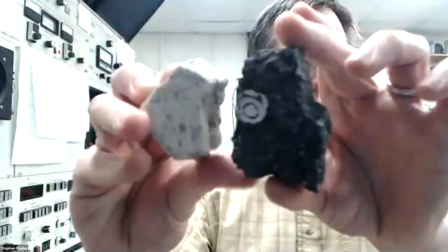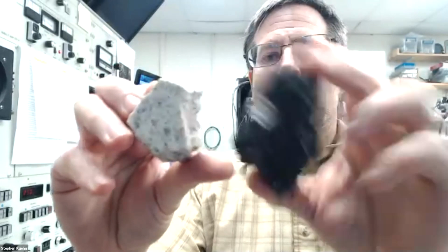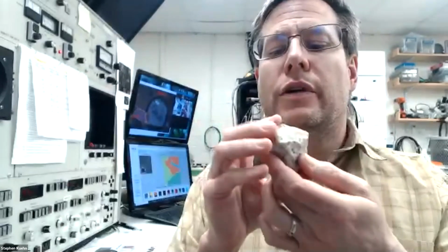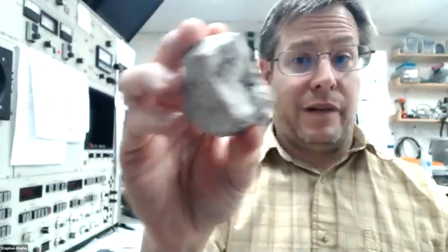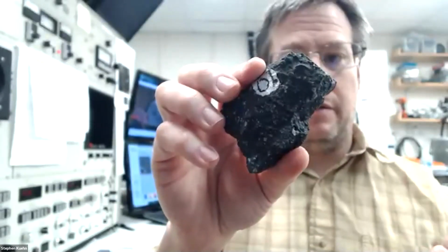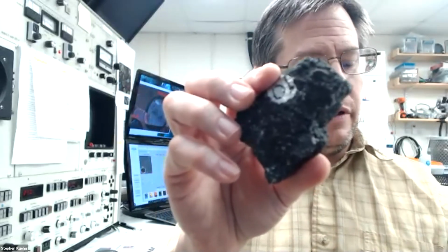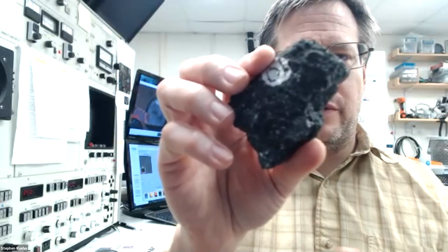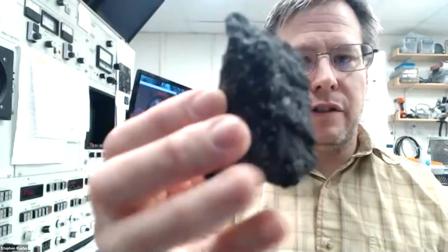And again, if I put them side by side, you can see there's a pretty big difference. One of them is a lot lighter and one of them is a lot darker. And so we have rock E with the alkali feldspar, the quartz, and actually turns out two kinds of mica, this particular piece of it. And then the rock O, the dark one with the pyroxene, plagioclase, olivine, and let's see, at least three. I was thinking maybe there was more. Maybe I'm forgetting something. Anyhow, the big green olivines, the big white feldspars, and then all the other tiny stuff in between.